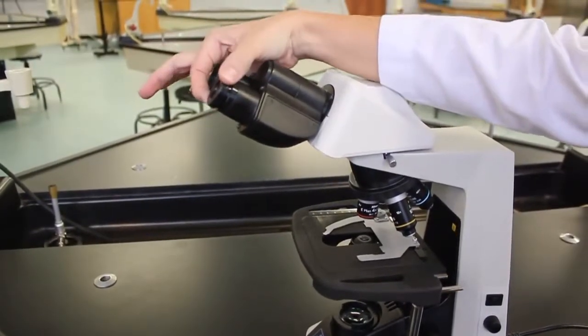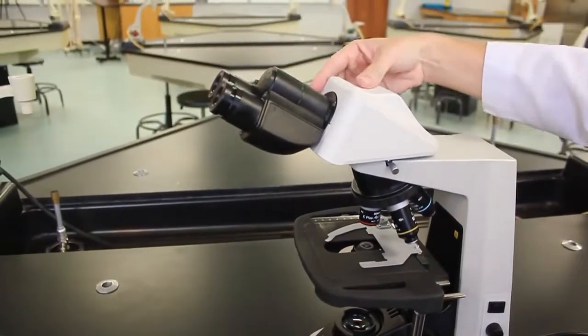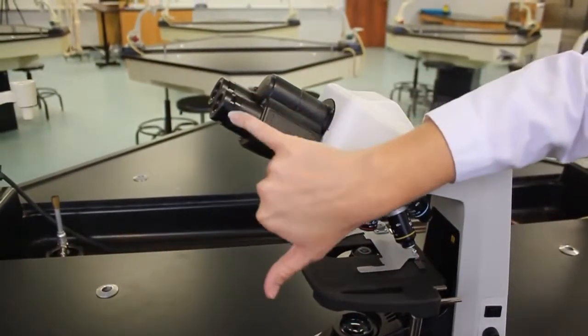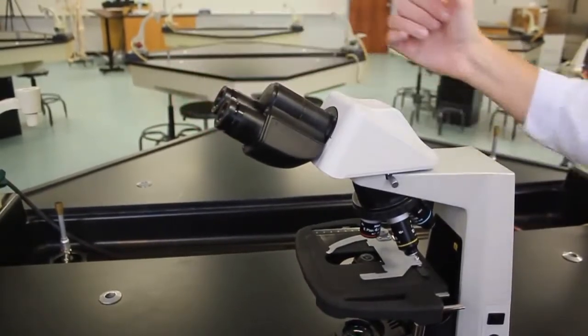You should not need to adjust the ocular. When I open the ocular all the way, you may be able to see that there is an etched line. The ocular needs to be even with that etched line.